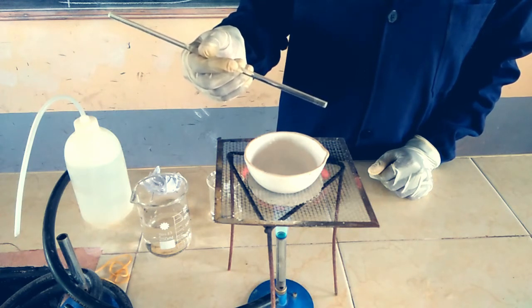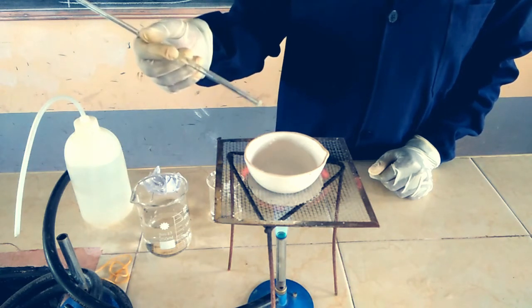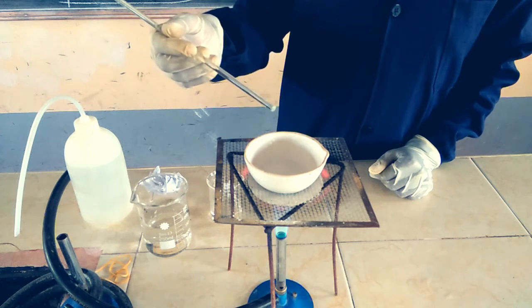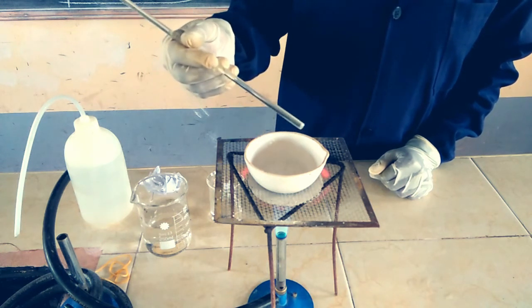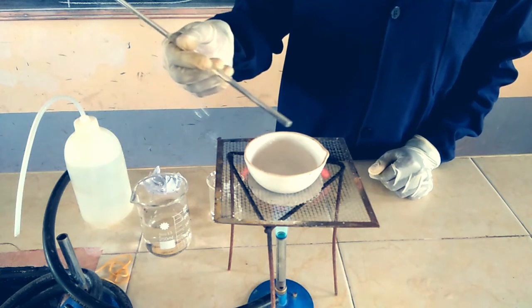We are just about to get what we want. Always be keen and observe to see if the salt is forming.